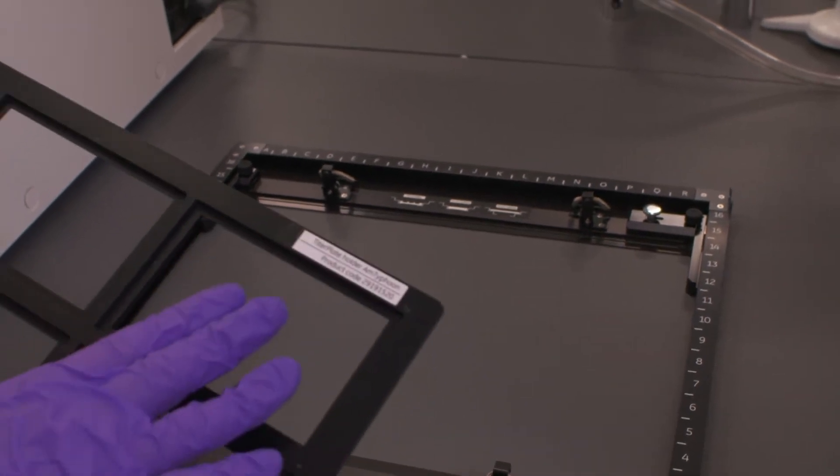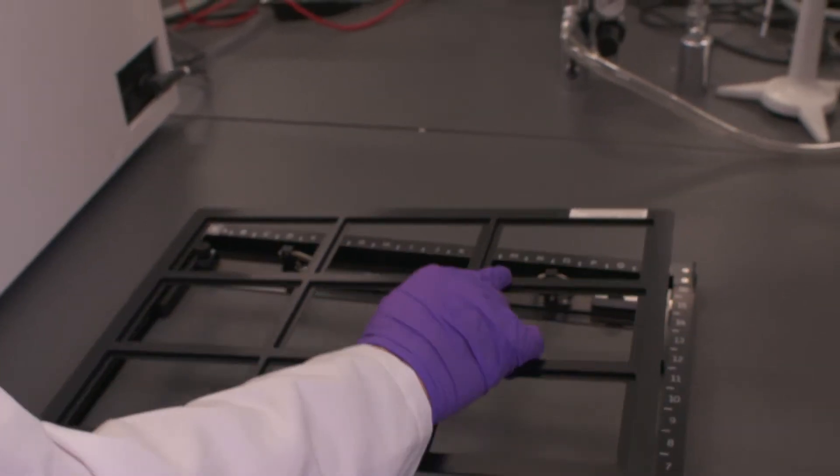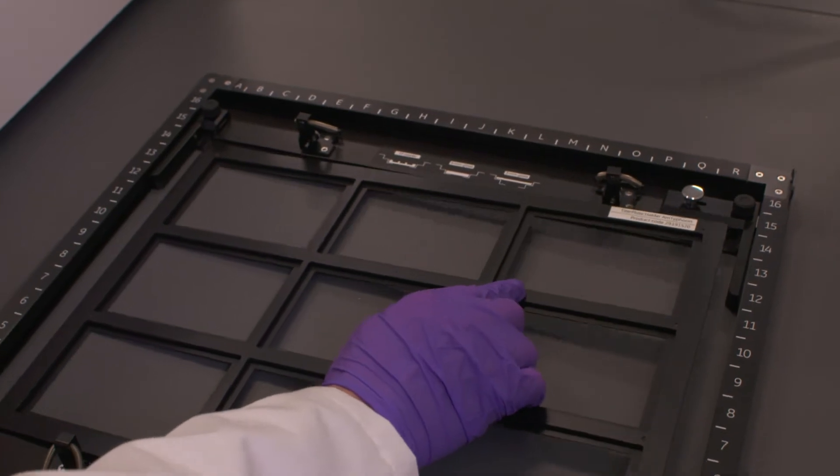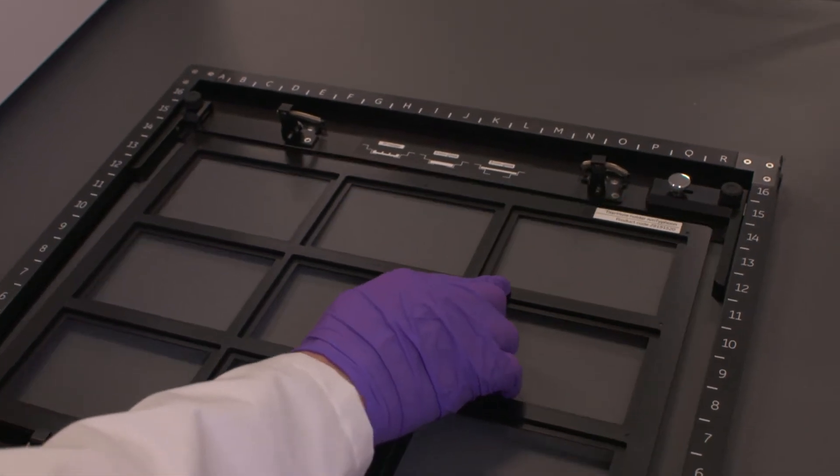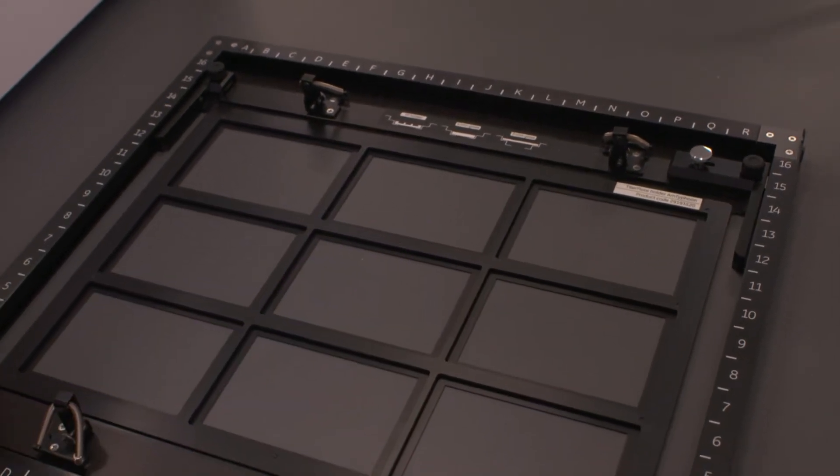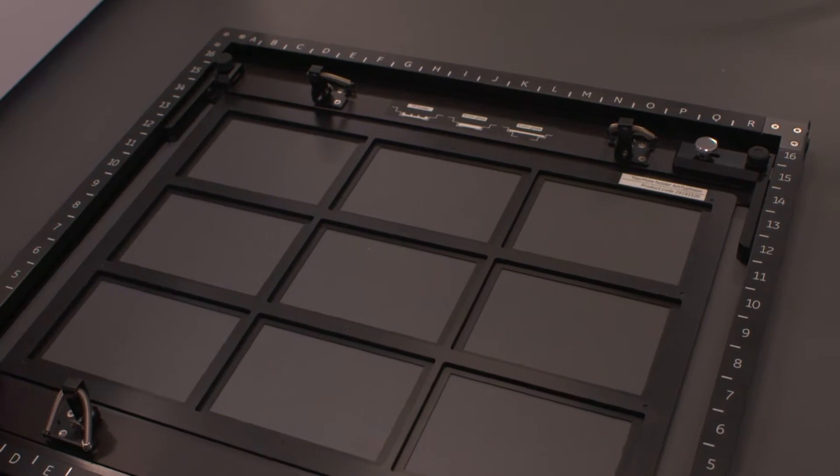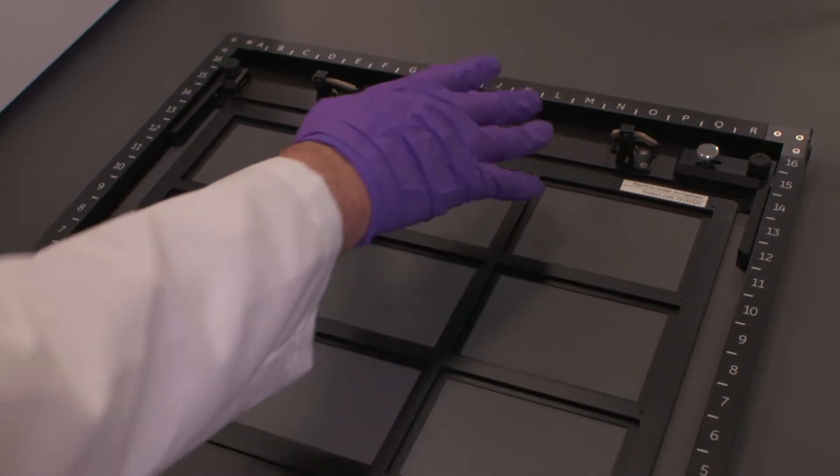We need to have the writing uppermost on this accessory. This will fit into the multi-stage between these two brackets. You want to make sure these are in the outer position.